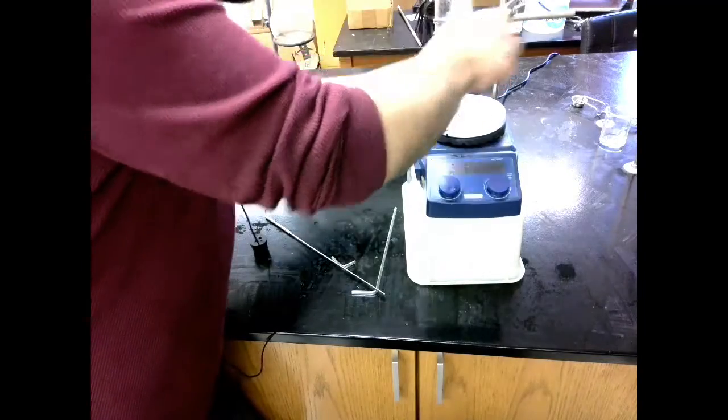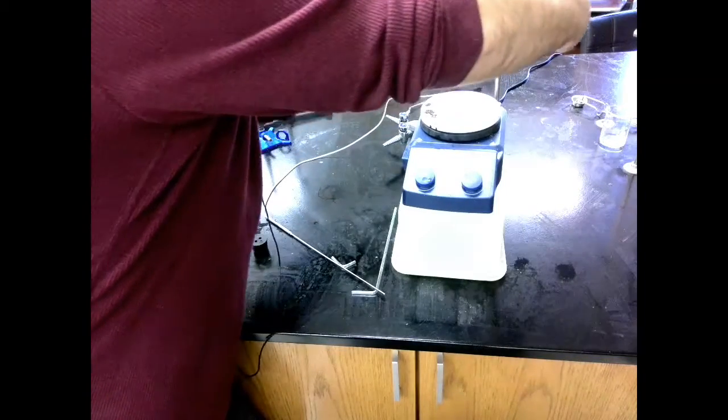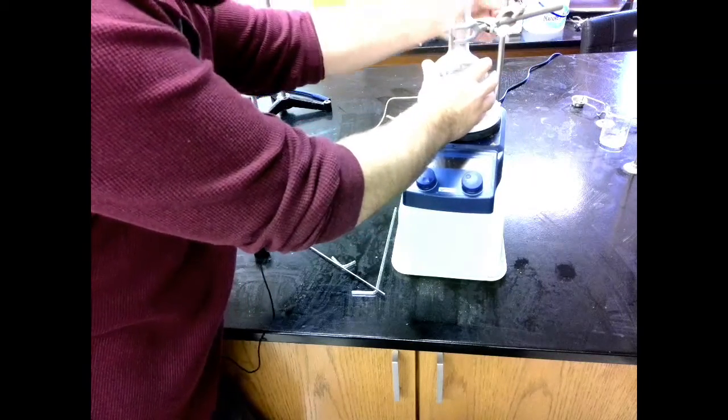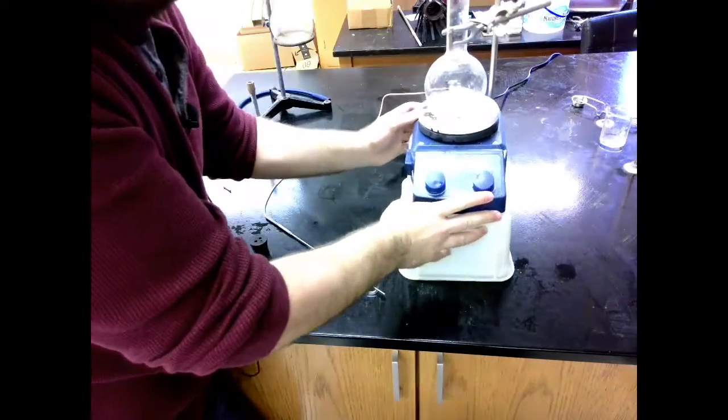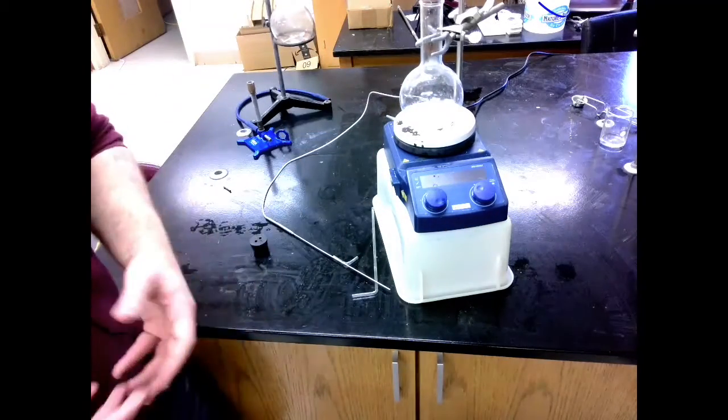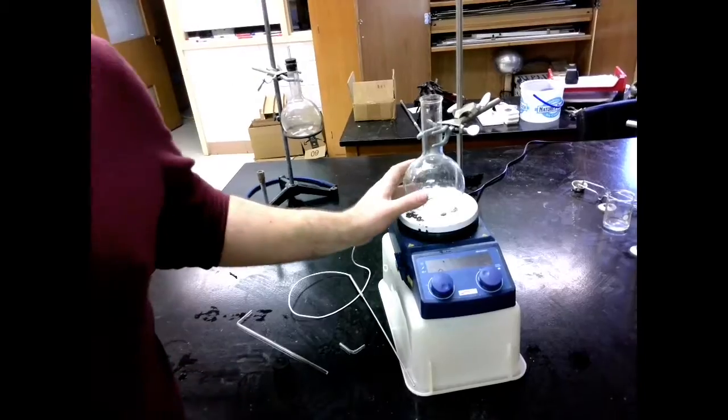This should all be screwed in. We don't want this to be able to wiggle around too much because it's very possible for this to get bumped. And we don't want that to happen. We don't want this to be able to fall off and break open and lose all of our material.